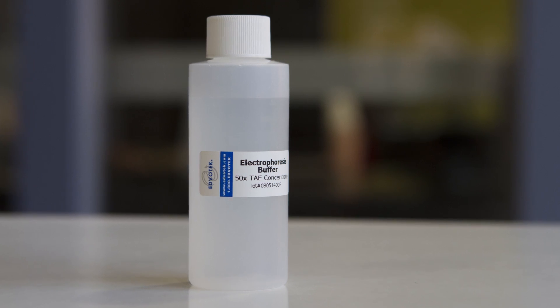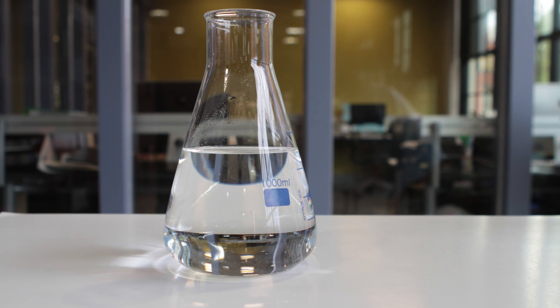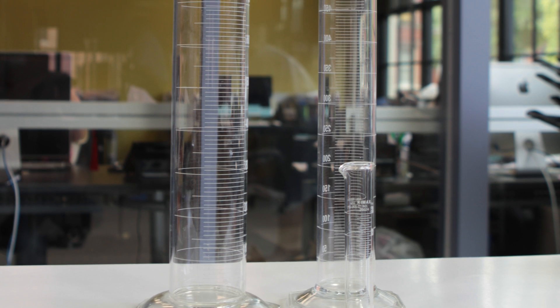For this technique, you will need a concentrated solution, distilled water, and graduated cylinders.